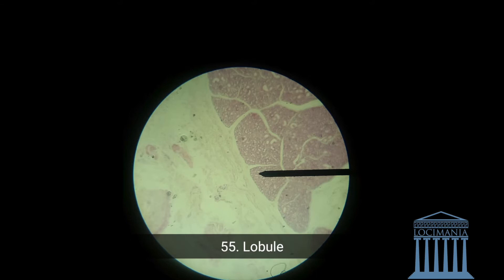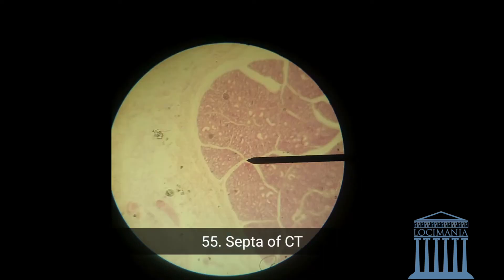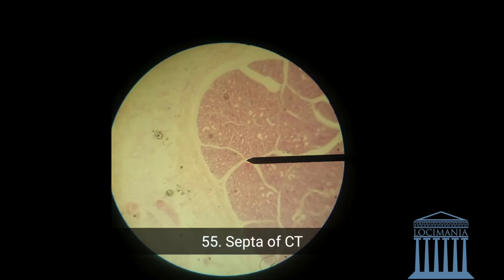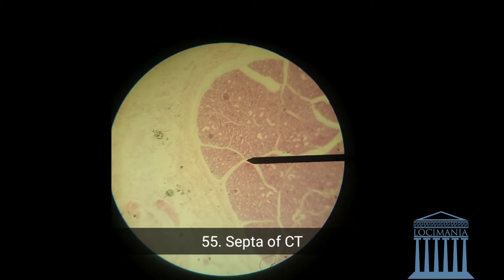Now I'm going to show you the septa of the connective tissue. Septa is like a space. That is the septa of the connective tissue — it's nothing critically important, but it is the septa of the connective tissue.